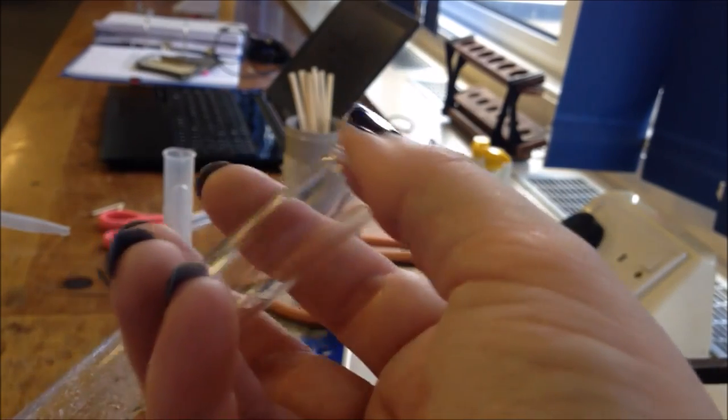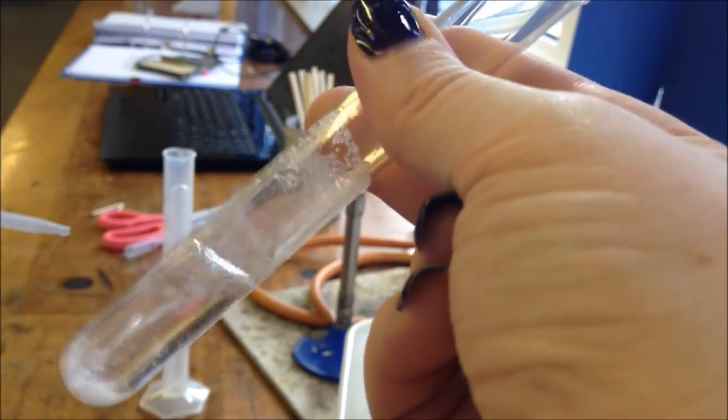What I see as a horror when I see my students doing this: they put their thumb over and try and turn it upside down, potentially putting their hands into who knows what kind of acid here.